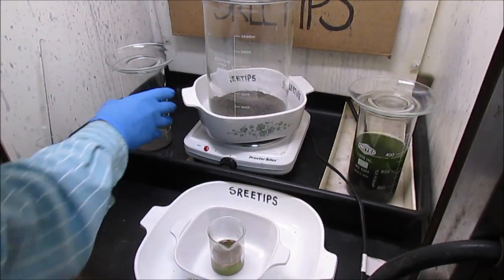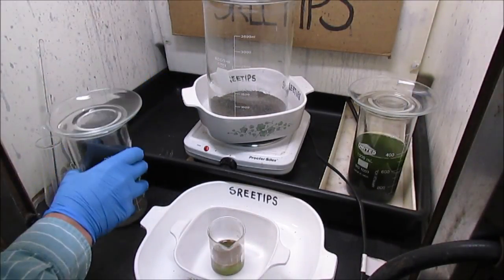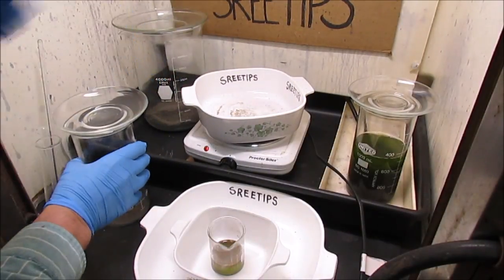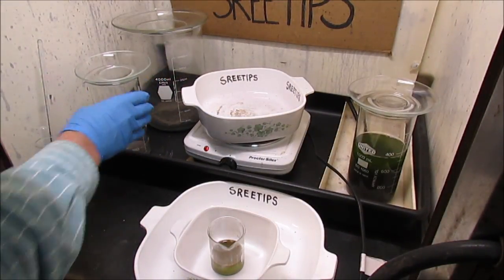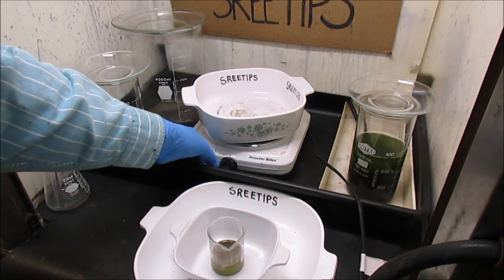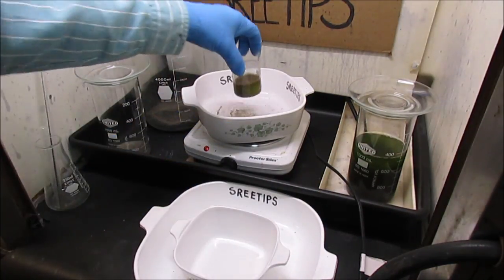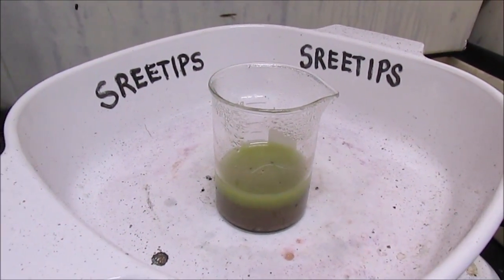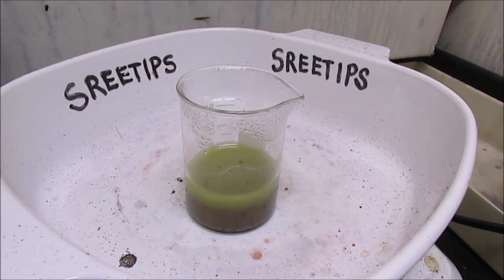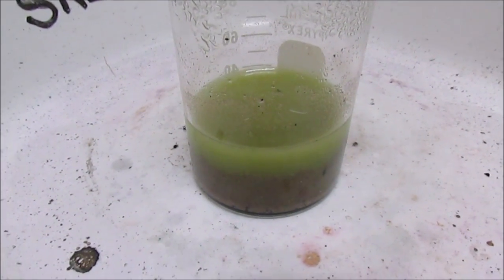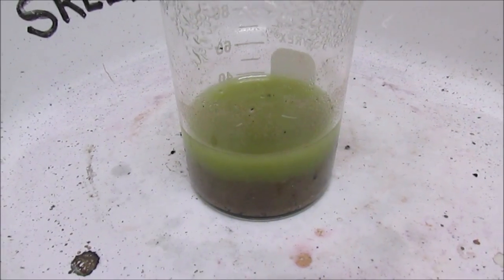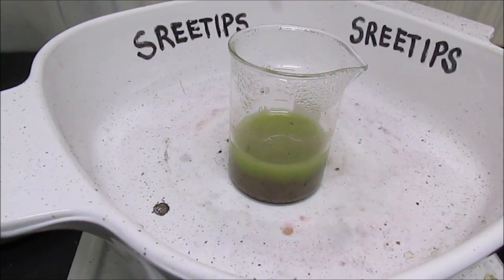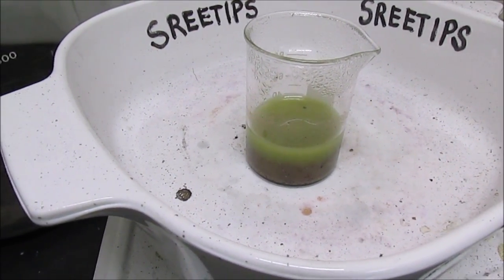Alright, I'm going to put the beaker up here on the heat. We'll add some heat to it and see if that does anything. Our piranha solution with our ash is here simmering on low heat. I'm just going to let it simmer for a while and then we'll get it out and do some more tests with it and see if this is a viable way to go with this.